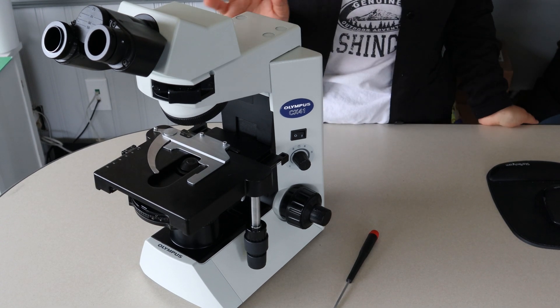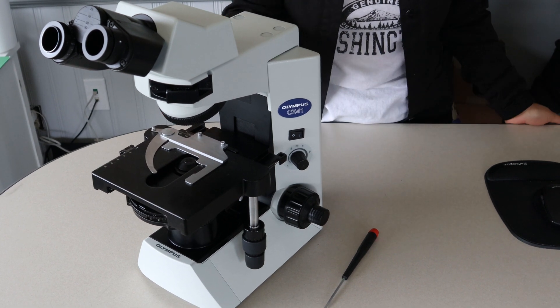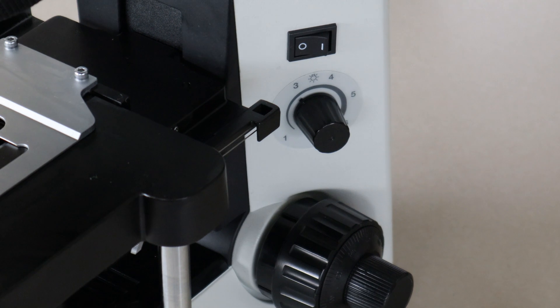To do this you're only going to need two things, your CX series microscope and a flathead screwdriver. Now let's go ahead and zoom in and show you how it's done.